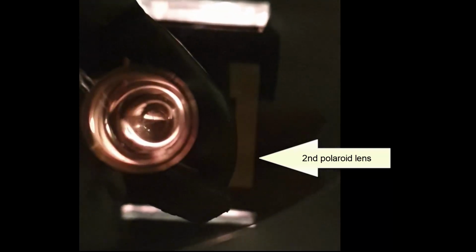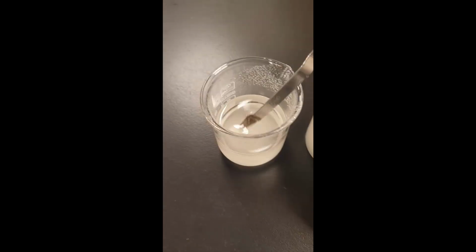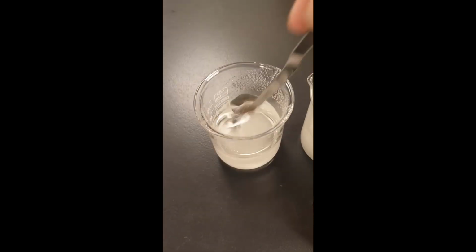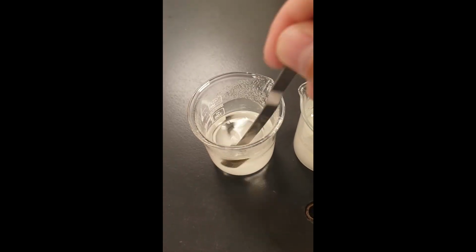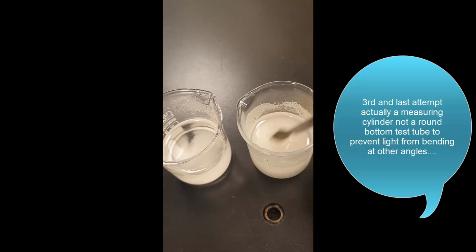for several reasons. So I made a syrupy solution and tried to get the max rotation of maybe 60. But then I found when I put it into the test tube, there were crystals in there and it was just too close to saturated. So I diluted it with some water, maybe at 50% or so.